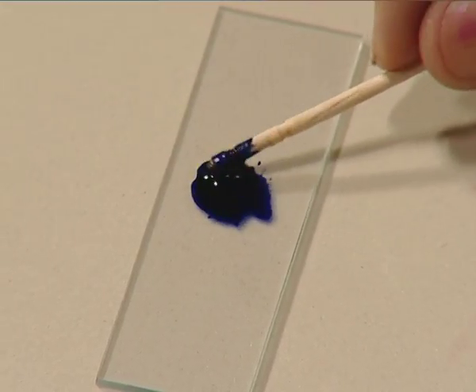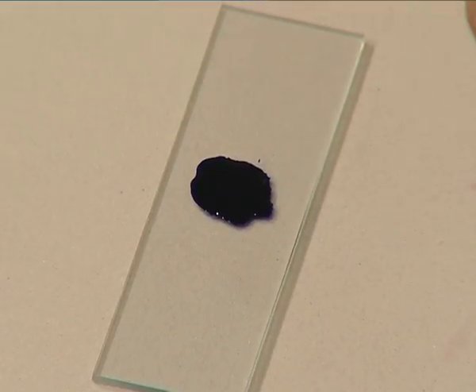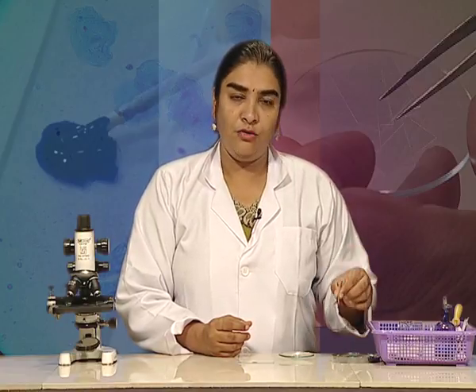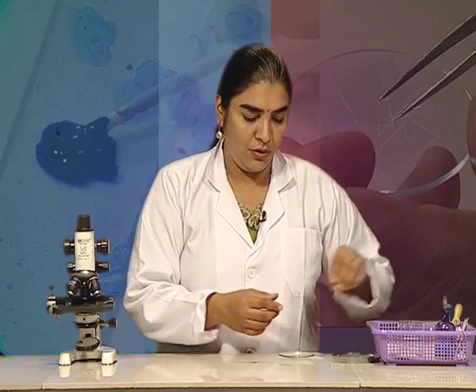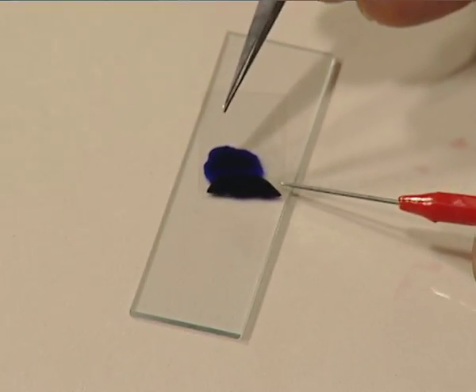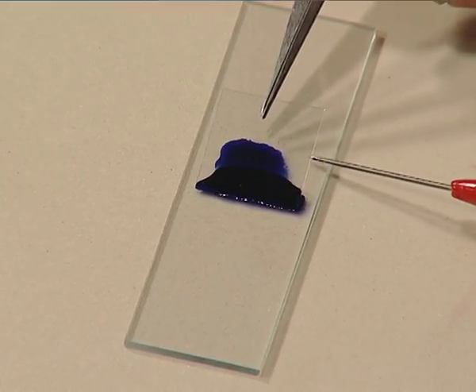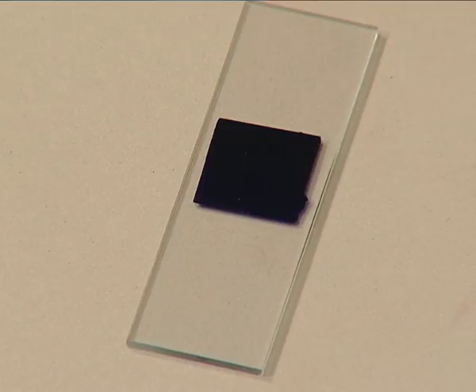Spread the material throughout. Please throw the used toothpick in the dustbin — it cannot be used again. Now, with the help of a forcep and needle, gently place a cover slip onto the material that has been mounted on the slide. Place it very slowly so that there are no air bubbles in the slide.